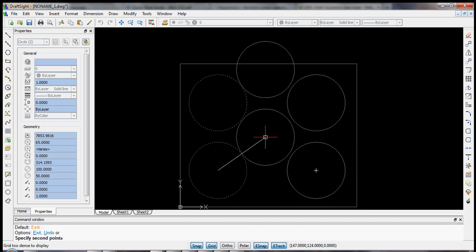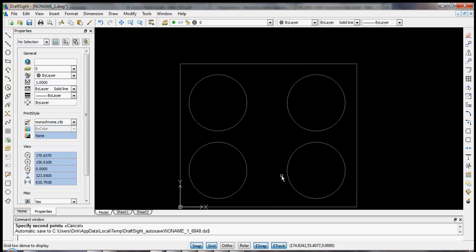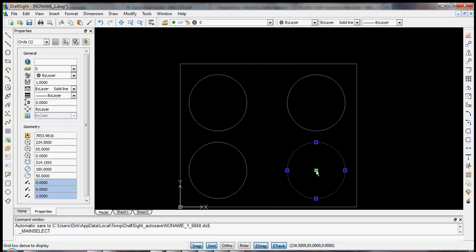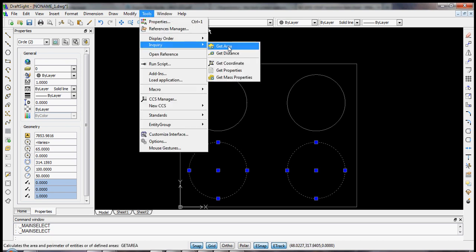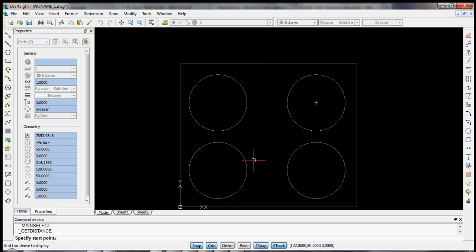And now somewhere in the middle, it looks like we'll just barely have enough room for another one. So let's take a look at our center point here, 234.5 and 65. Now if we want to measure the distance between these two center points, we can go to Tools, Inquiry, and Get Distance. We can hover over the center point.